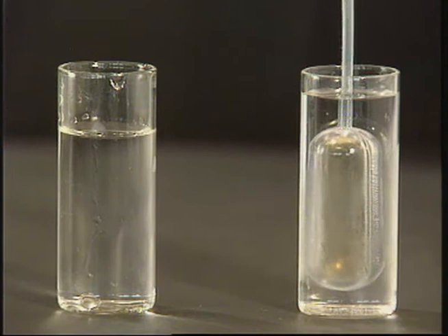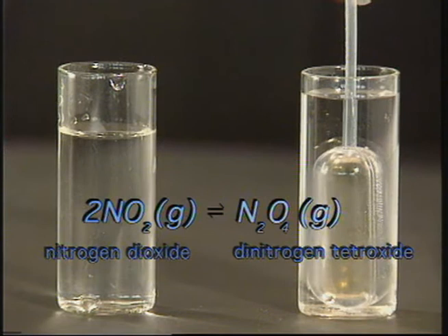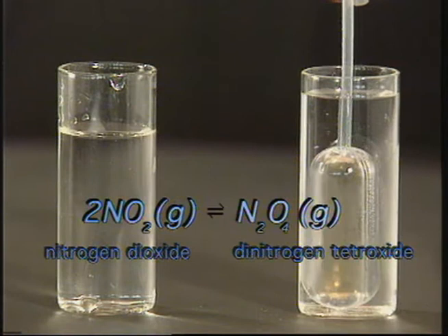When the nitrogen dioxide was collected in the bulb of the propette, it was in equilibrium with a colourless gas called dinitrogen tetroxide. This gas equilibrium is affected by temperature.